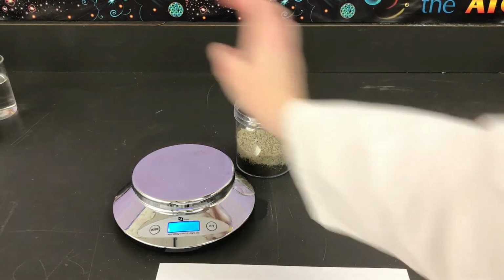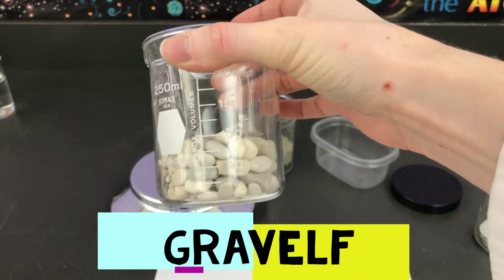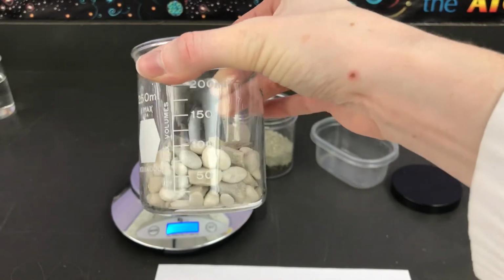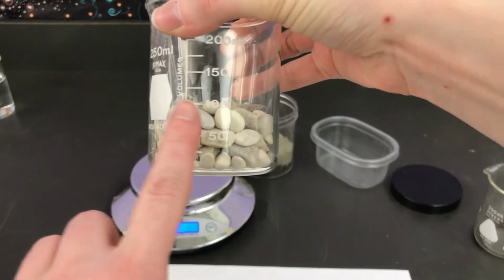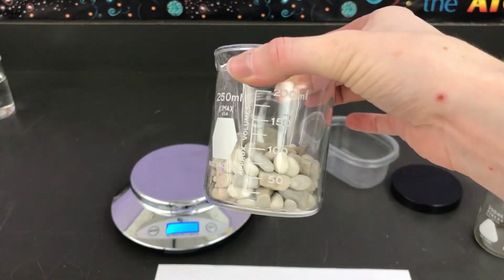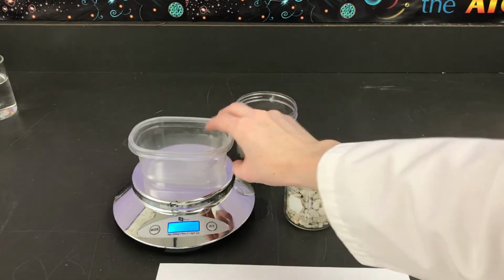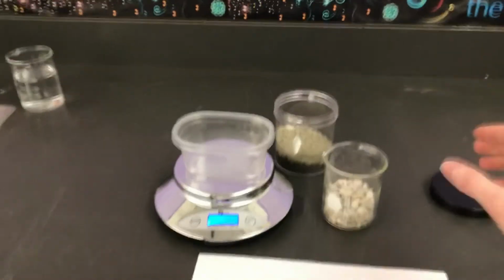All right, our next substance is going to be gravel. Now this is gravel, it's small rocks, and you can see I've measured it out to what volume? That's right, 100 milliliters again is the volume of our gravel. And we're going to measure the mass now of it.